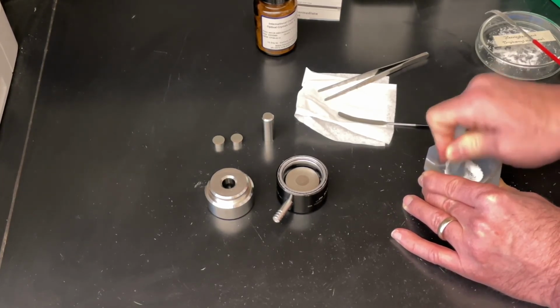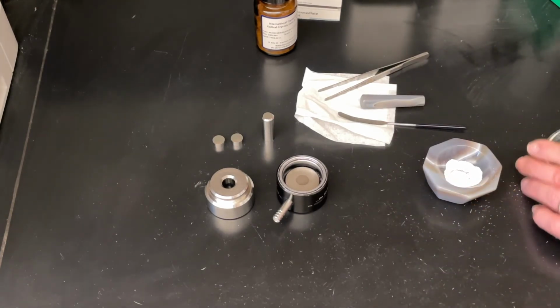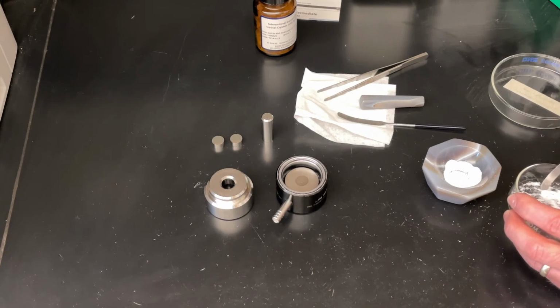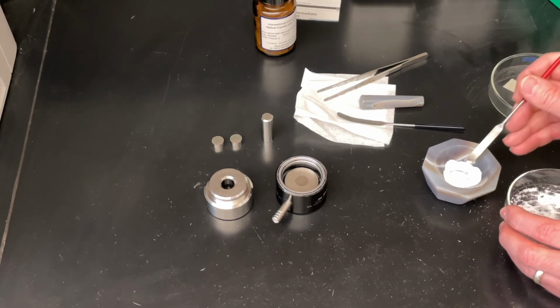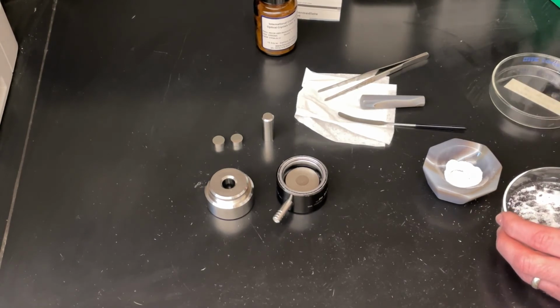And once it's ground, then we are going to apply a little bit of our triphenylmethanol that we recrystallized into this. We want about a 1% solution, so it doesn't take very much. It might even be more than I want, so I'm going to take a part of that. I'll tap it in there. And the rest that I don't want, I'll put back.